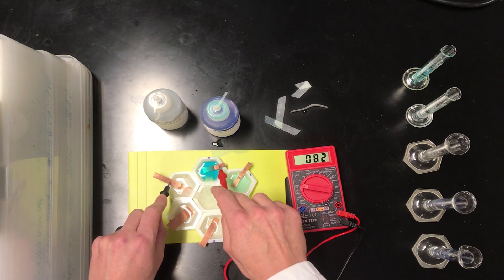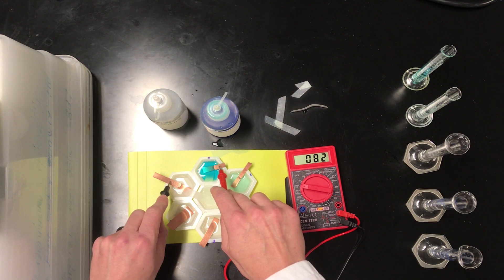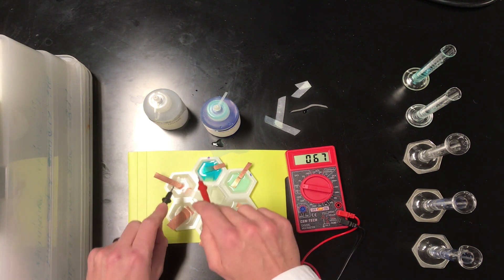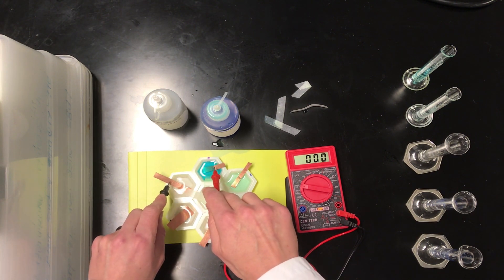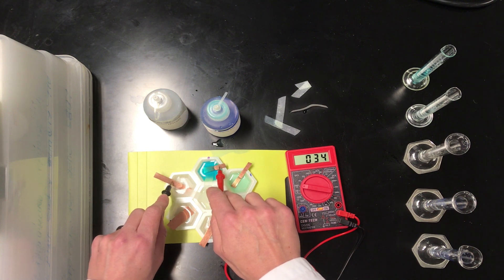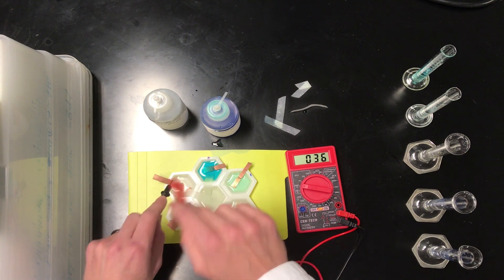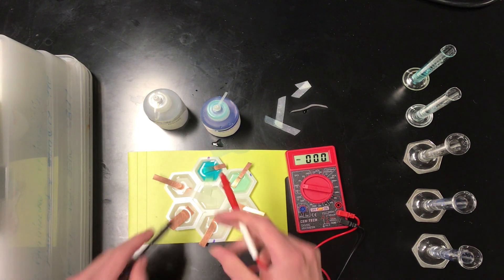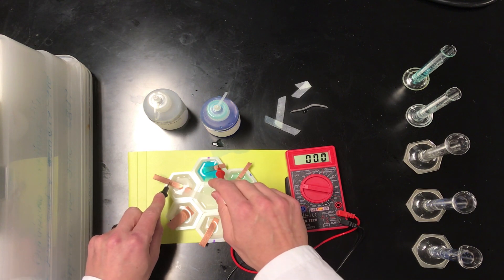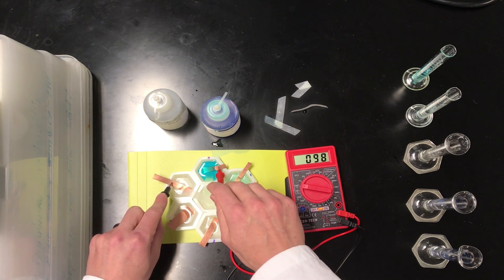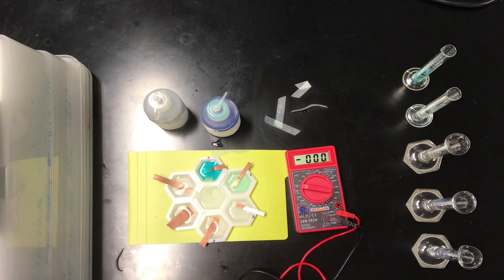And here we have a big jump up to 82 millivolts. Let's try that again just to make sure we got the maximum. Whoa! Saw that get up to all the way up to 96. Let me try that one more time. And I think we can call that 100 millivolts for the maximum there.